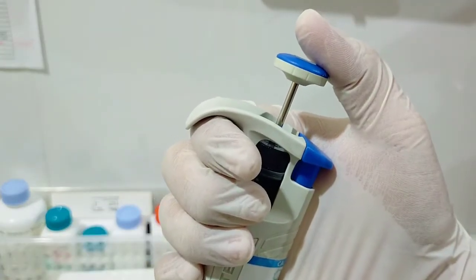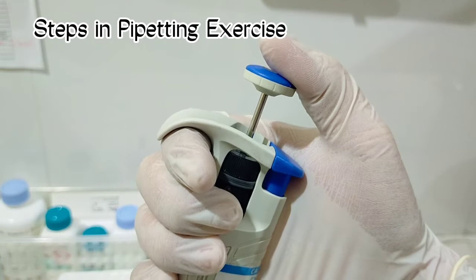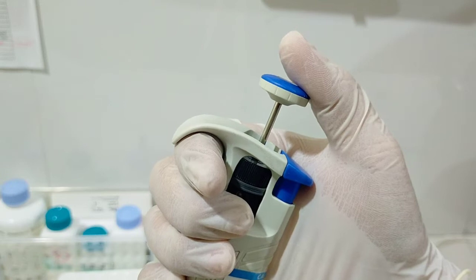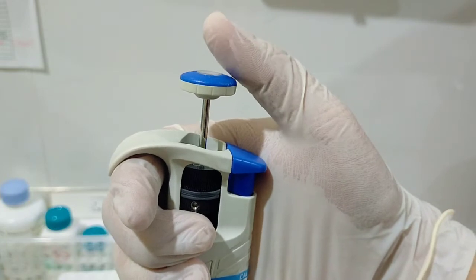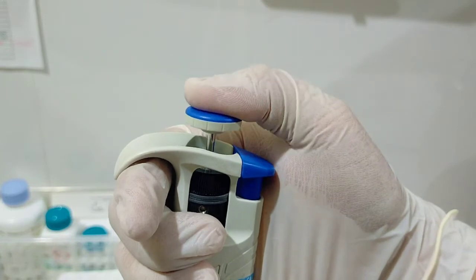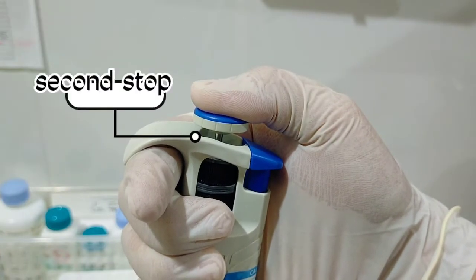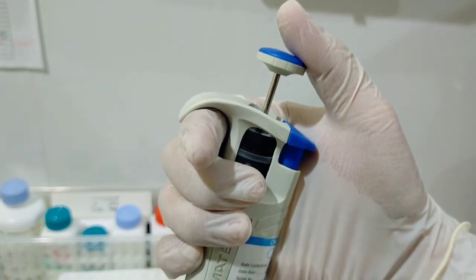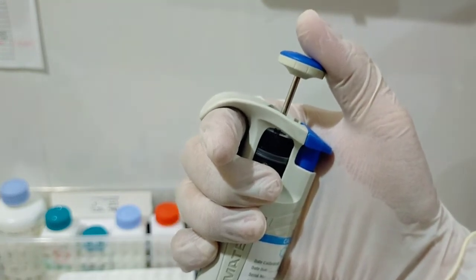Now I am going to demonstrate the different steps involved in pipetting. We have the preparation, aspiration, distribution, purge, and the home or resting position. Look at the pipette push button. This is the resting position or the home position. If you press it downward, that is the first stop, and then push it again, that is the second stop. When you are using an automatic pipette, you can actually hear and feel the sensation that you are hitting the first or the second stop.